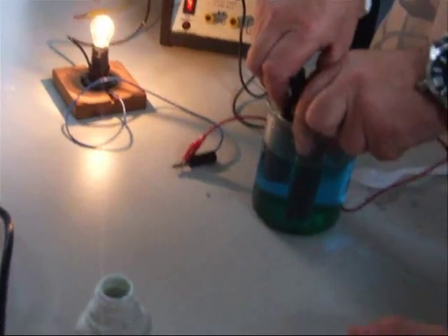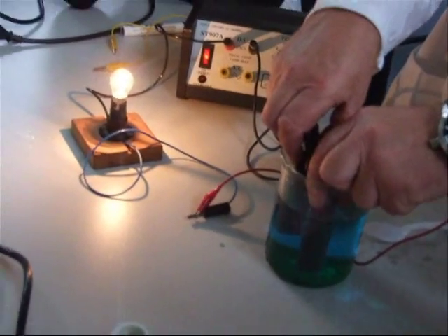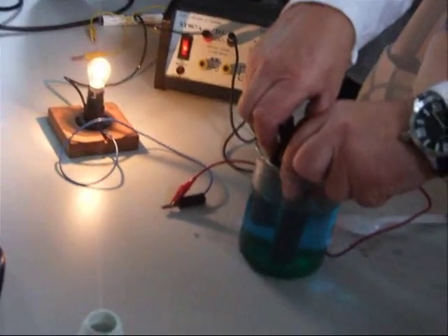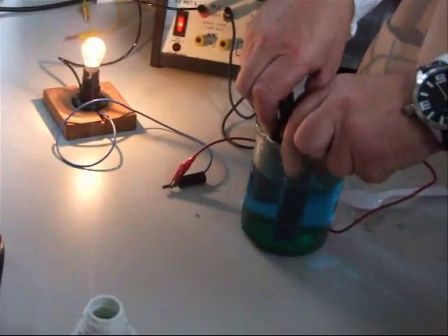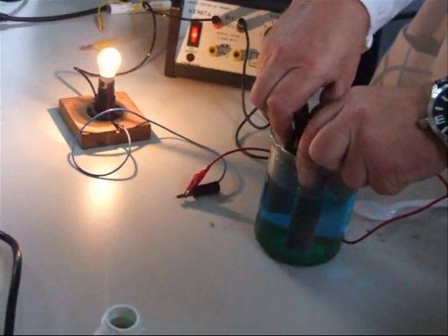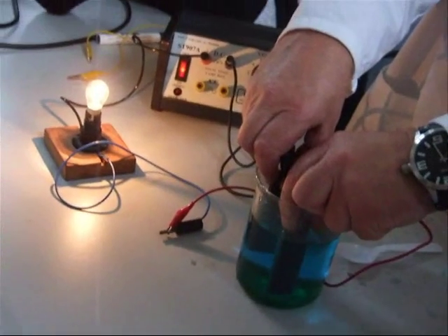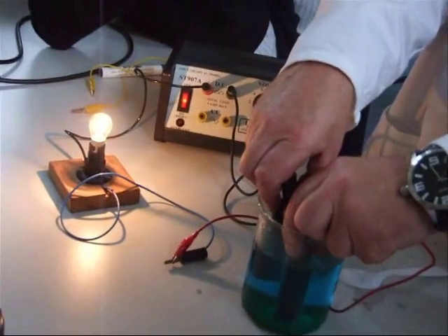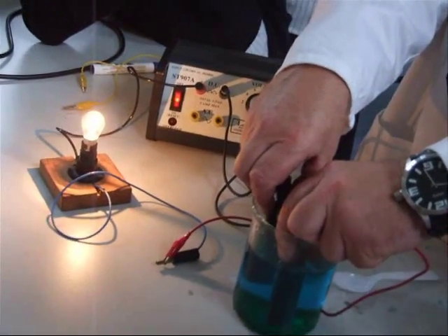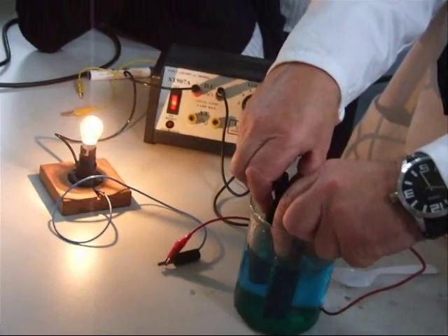So the electric current that flows is actually ions moving through the solution. We've learned a little bit more about ions today — we've watched them individually switch, lose electrons, and move around in the solution.